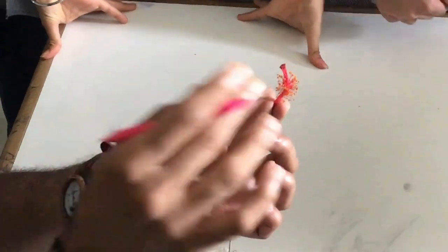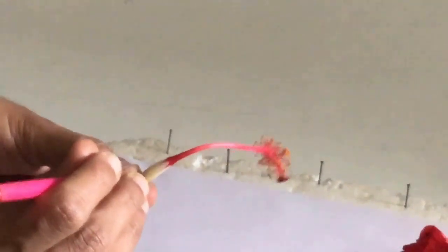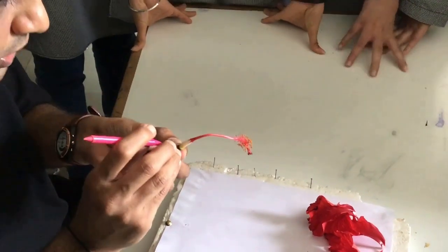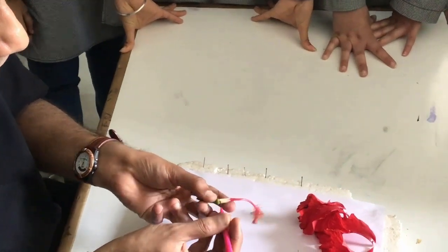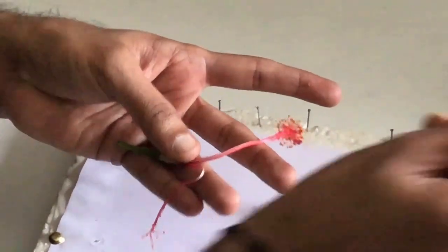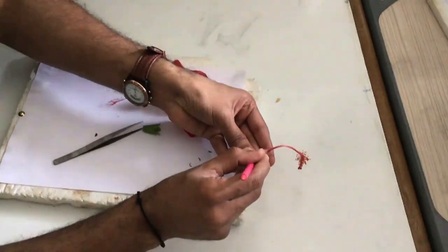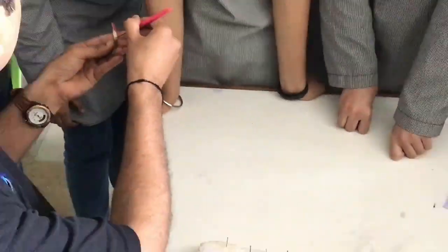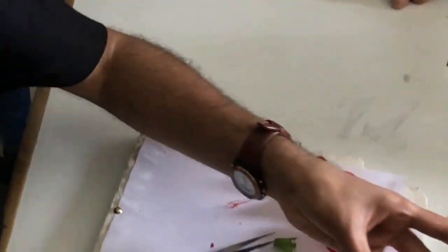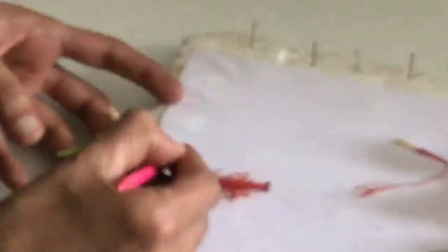I need to separate the male and female parts. I will put a small cut here without penetrating the ovary, going to the side. You can see: these are all anthers and these are all filaments. Inside, this yellow part is the ovary. The thread attached to the ovary is the style. So: stigma at the top, then style, then ovary.